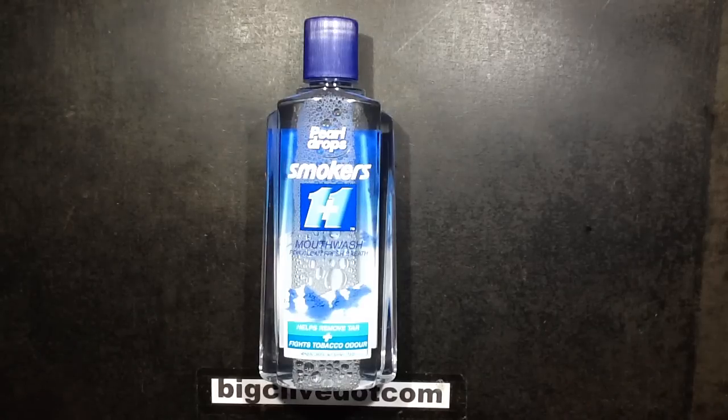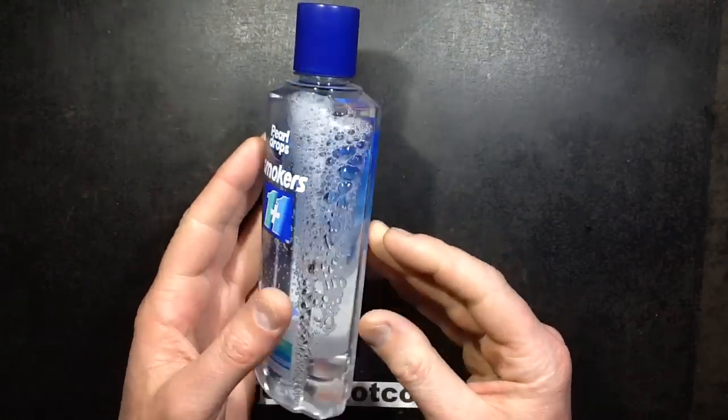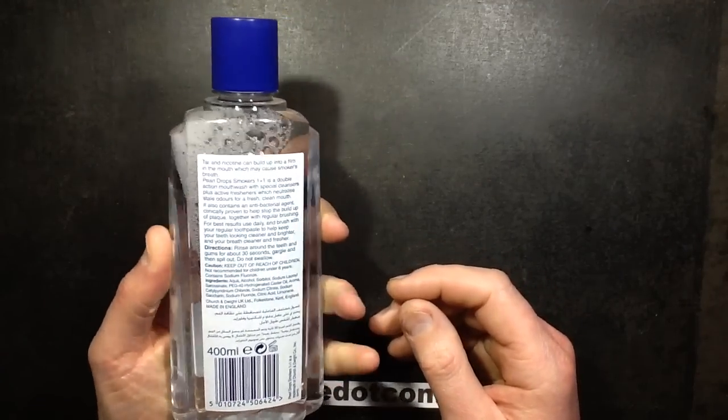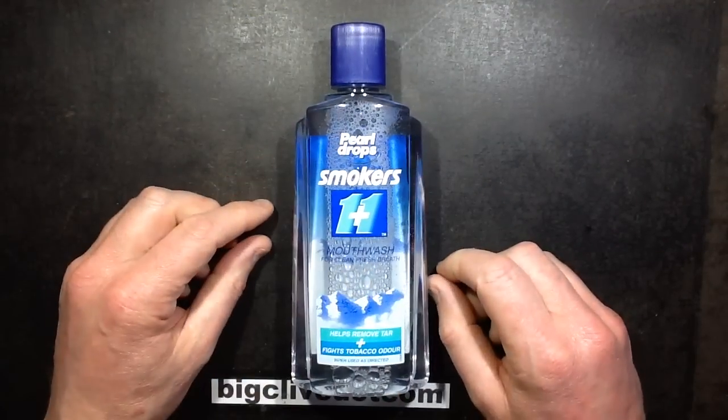I've always wondered what would happen if you got some mouthwash, alcohol-based mouthwash, and distilled it to remove the alcohol.